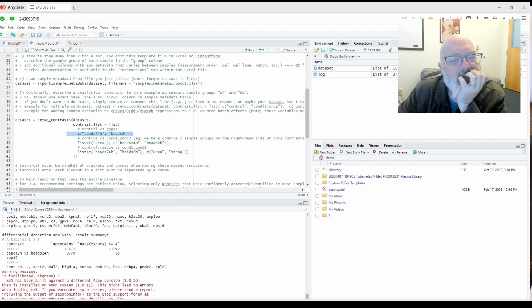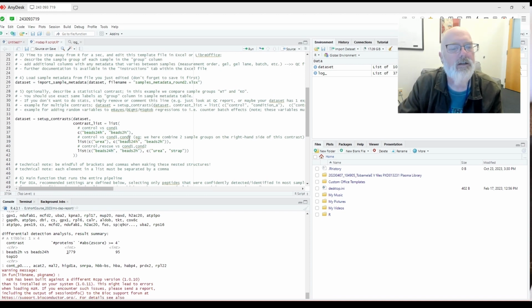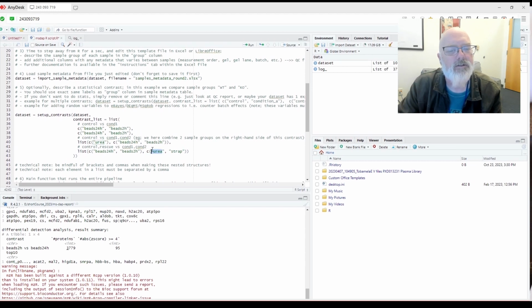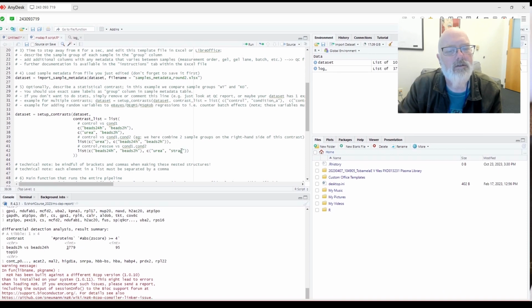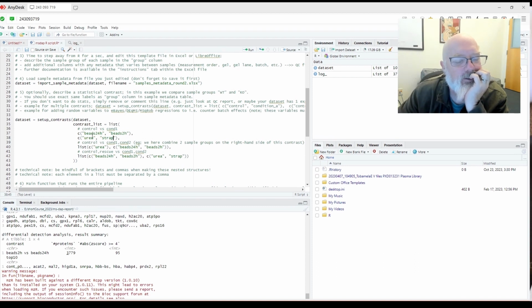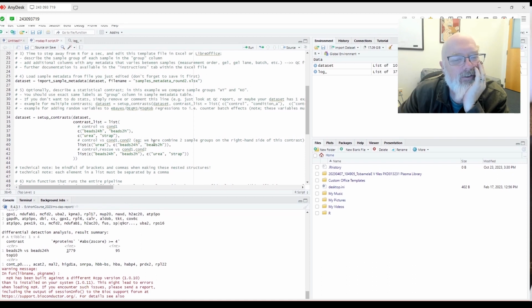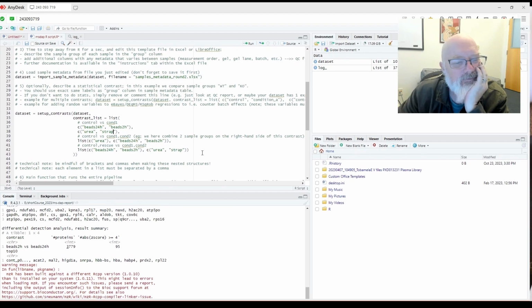And for example, if we wanted to do just S-trap, if we wanted to do urea, we can set up all sorts of contrasts. Let's see if this works. I think that should work. So we're comparing beads 2 hours versus 24, urea versus S-trap, urea versus all the beads combined, and then all the beads combined versus urea and S-trap. Does that make any sense?